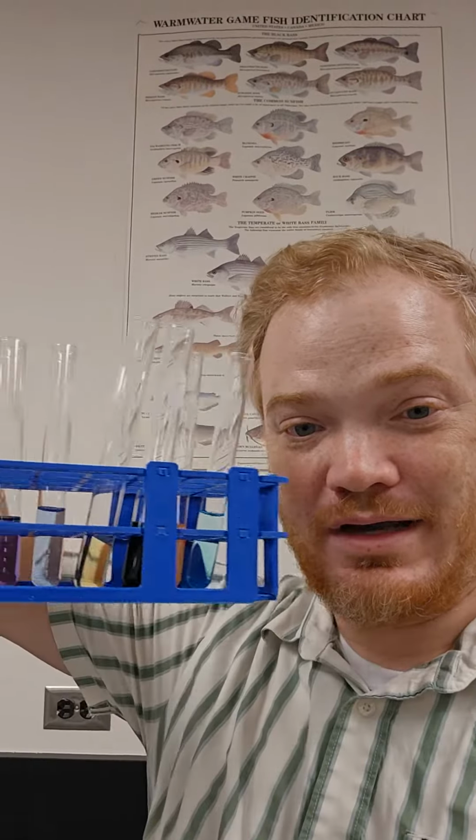And what I have here beside me are the organic molecules test tubes that you might see on your lab midterm here at Shelton State Community College. So what I'm going to do is run you through these real quick and have a little bit of a conversation about them.